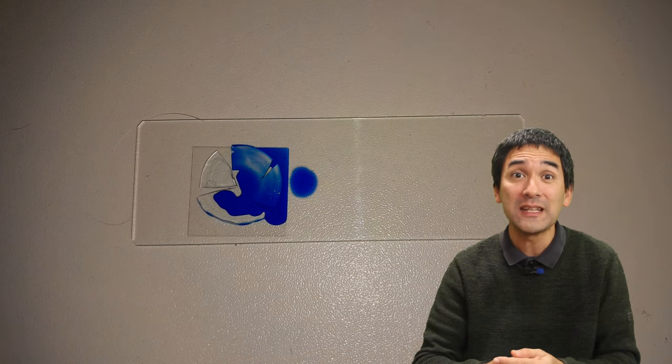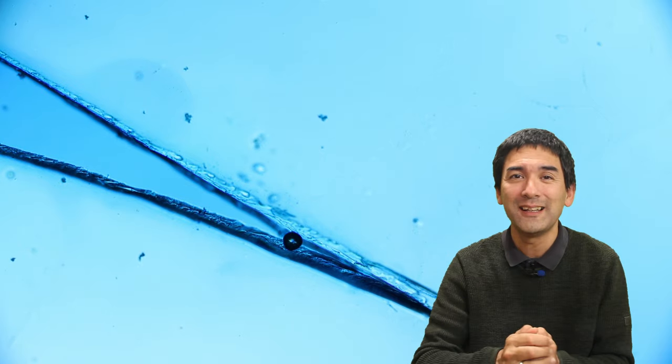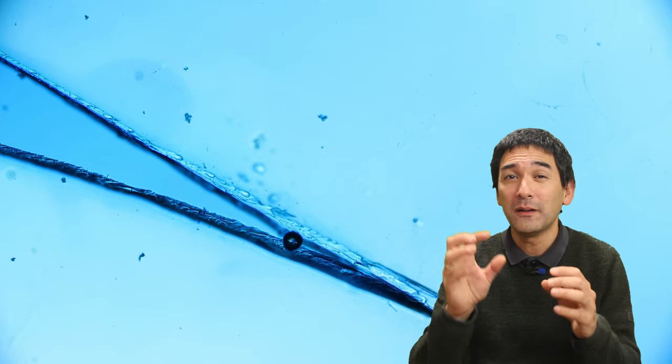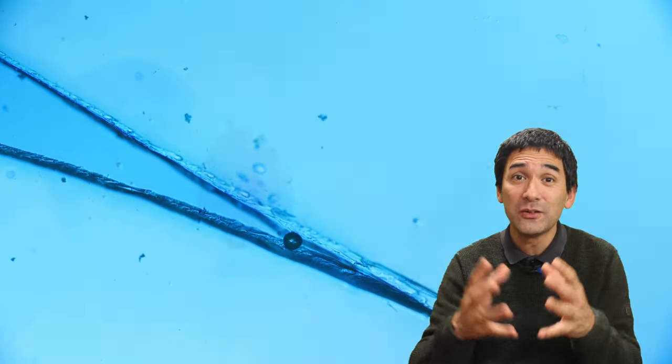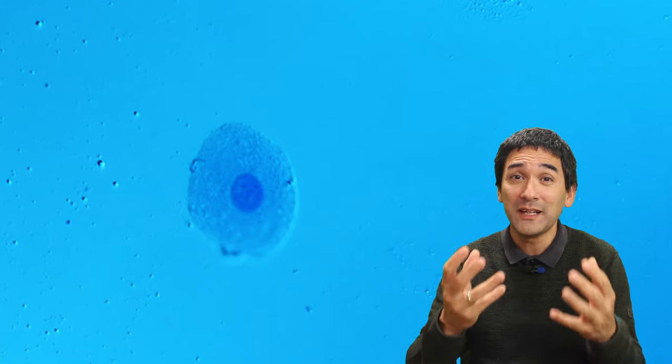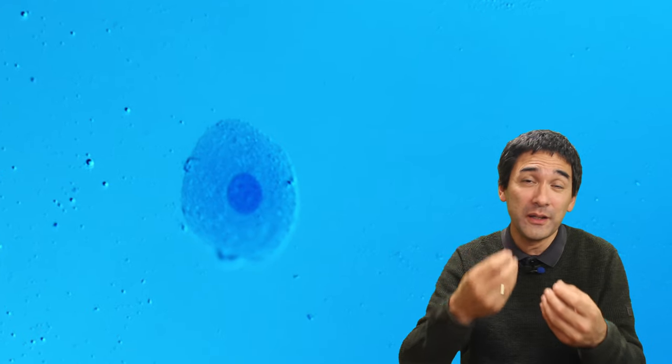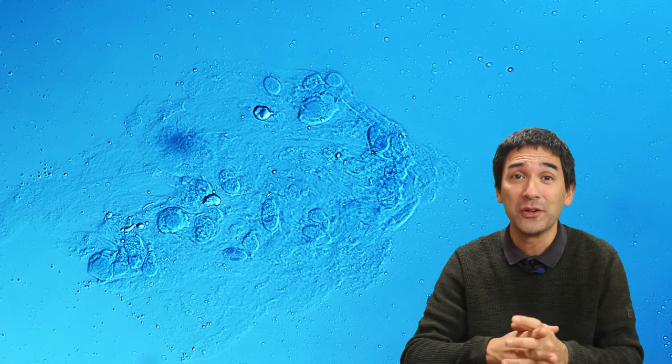I'm now adding a little bit of methylene blue stain. This thing that you see here is basically where I cut the contact lens with my scissors, but you might also see some darker dots and these are all cells and proteins. Here is a nice cell with the nucleus in the center, so evidently the contact lens when I removed it took along some of the epithelial cells of my eyes as well.